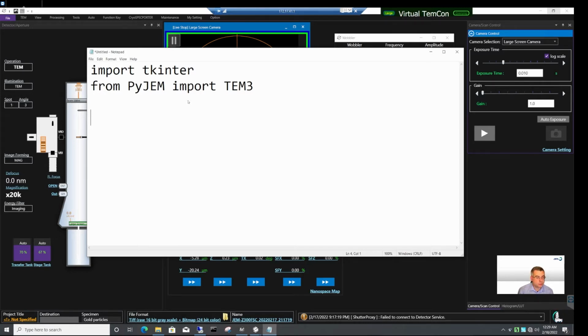Okay, so we need these two imports. The next thing to do is to create a lenses object. Let's call it just lenses, and this is TEM3 lens3 class object. And then we also need a window. Let's just call it window, and this is tkinter.Tk class object. Then we need some form of storage. We need a container that will store the CL3 value for us.